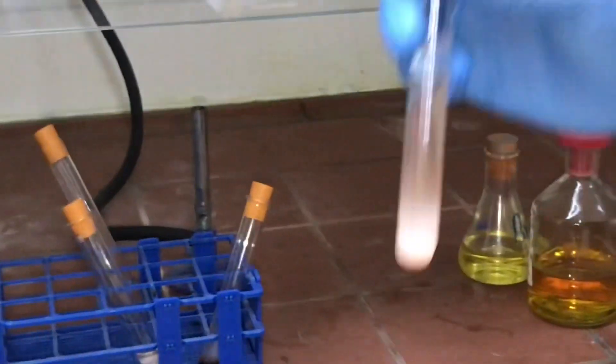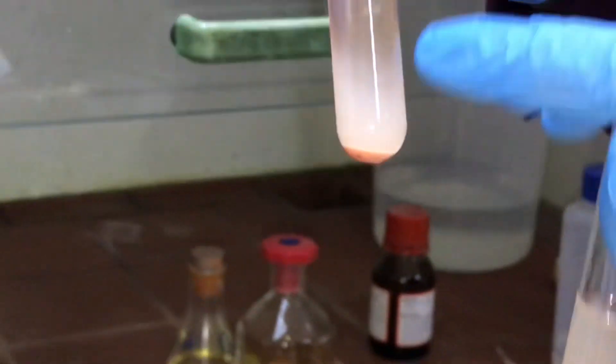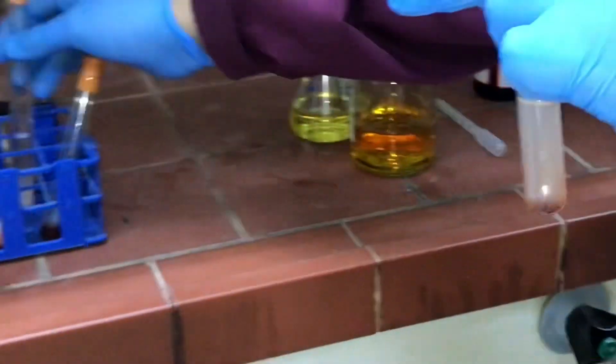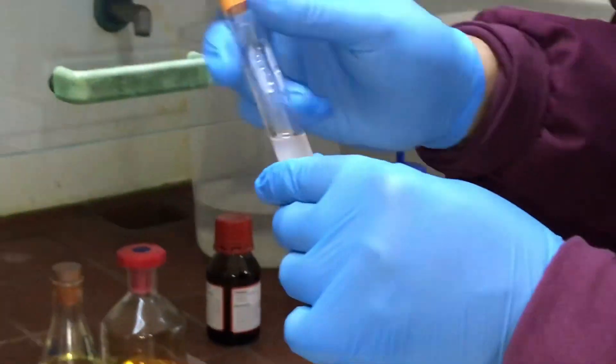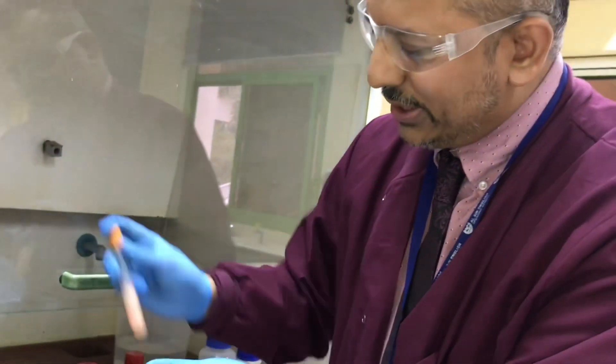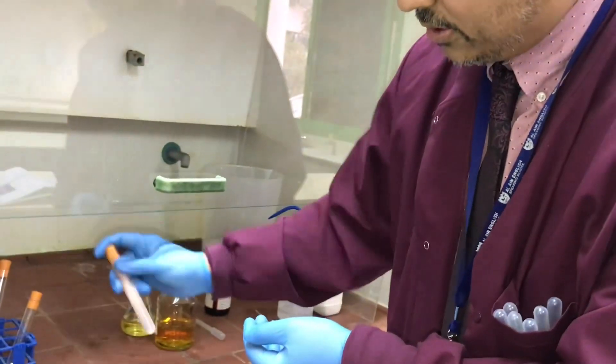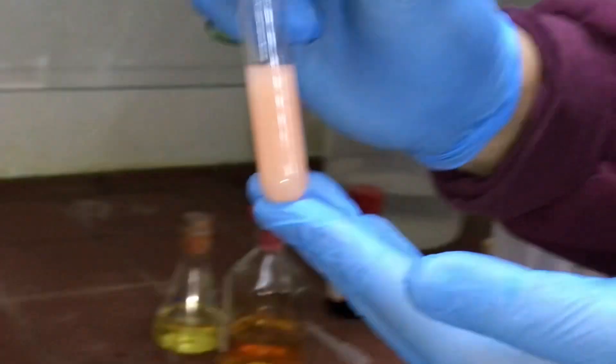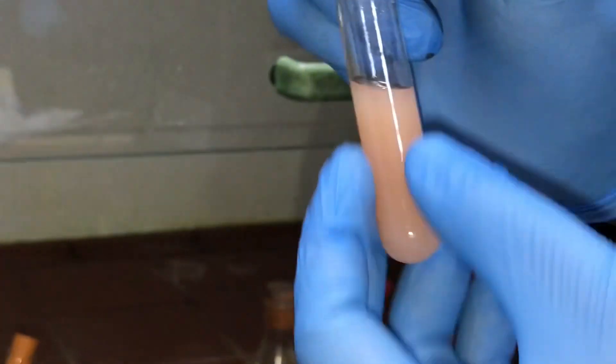With this example we tried to vary the concentrations and got some lovely precipitate. If you focus at the bottom you can see white powder—this was with very dilute bromine water. That's a very unique reaction, positioning our bromine wherever it's allowed.